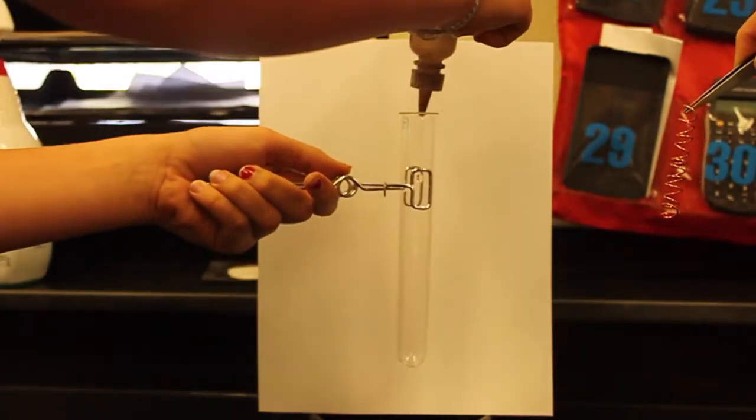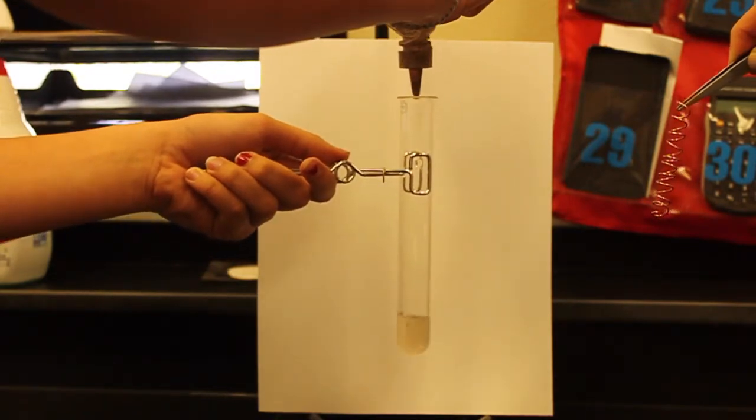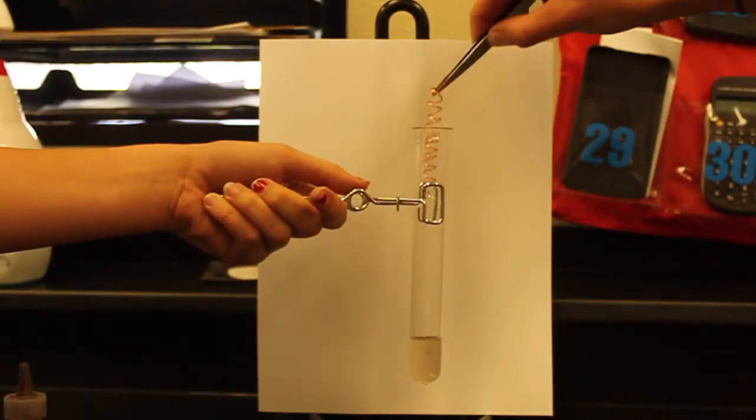Silver nitrate is a transparent beige yellowish colored solution. After adding ten drops of solution to the test tube, we placed the solid copper to the solution.